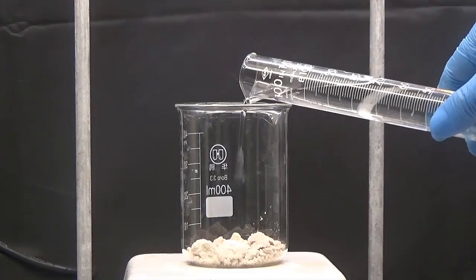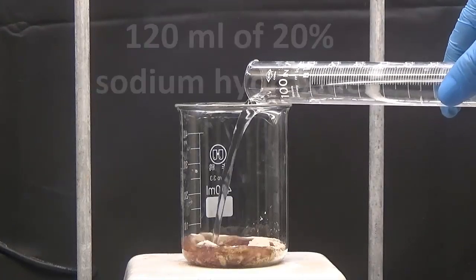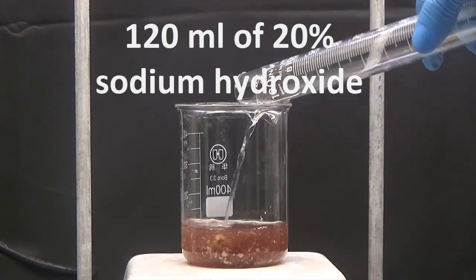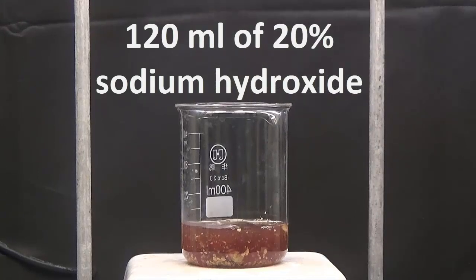For purification, the obtained solid is diluted in 120 ml of 20% sodium hydroxide.